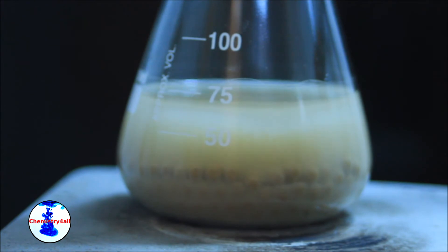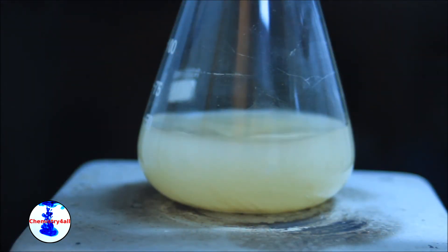The system is roughly filtered to remove the sieves. As you can see, there is quite a lot of dust left, but this is not really a problem since we are going to remove any impurity left by means of a simple distillation.